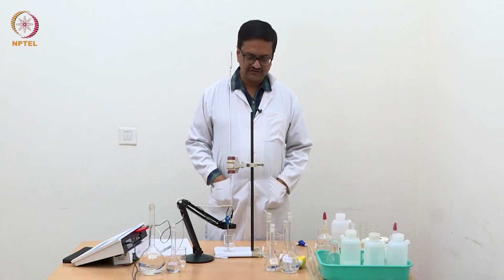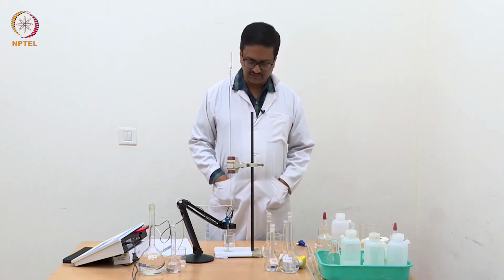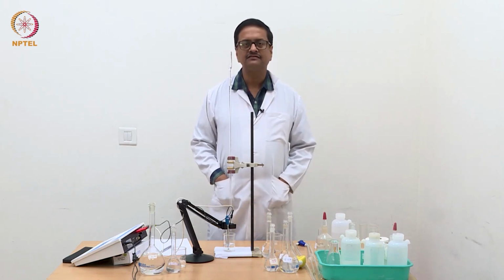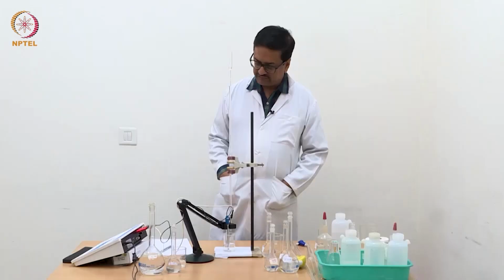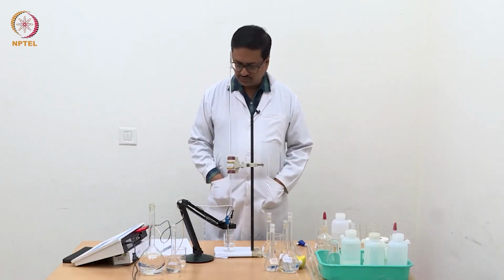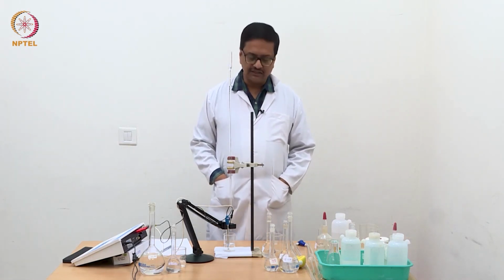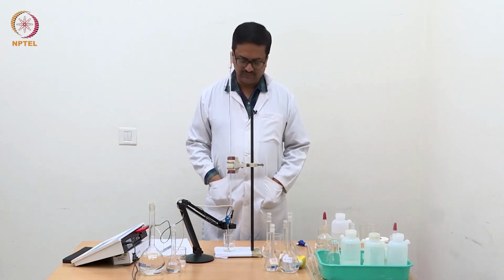Welcome back to this experimental demonstration in the course Elementary Electrochemistry. In the previous video, we demonstrated the conductometric titration of strong acid versus strong base, and we got the readings noted. We will discuss the readings, how to plot the graph, and then how to get the endpoint from the graph after we complete these experiments.